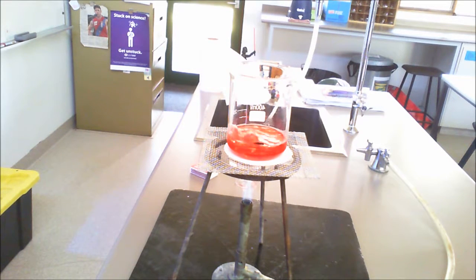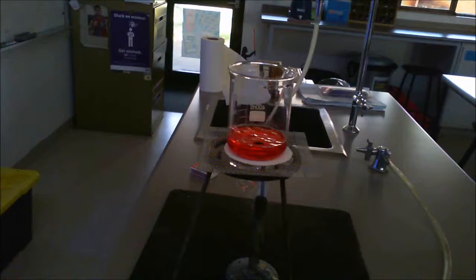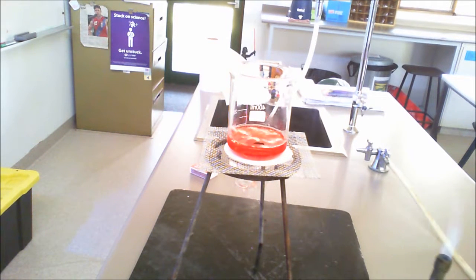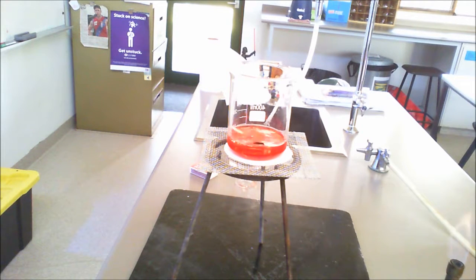So what I'm going to do is let it boil for a little bit longer, then I'll take the flame away and we'll be able to see where the amount of water is compared to the line that we started with. Okay, it's been a little bit longer now, so I'll remove the flame and place that onto a safety flame, because we will be reusing that.